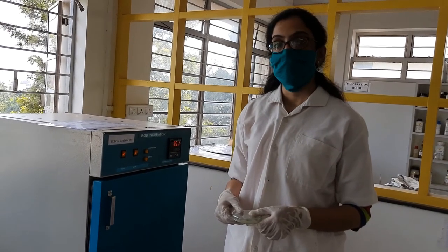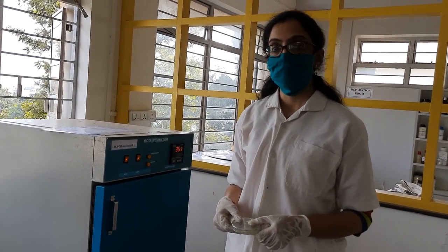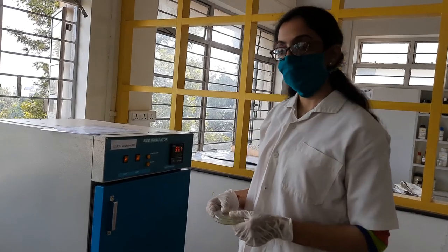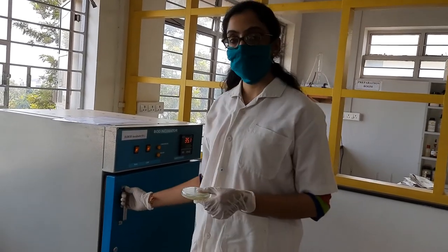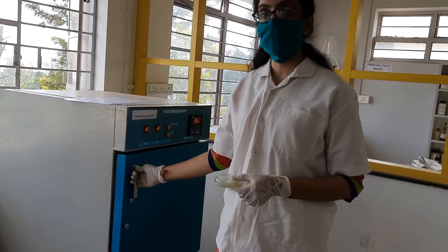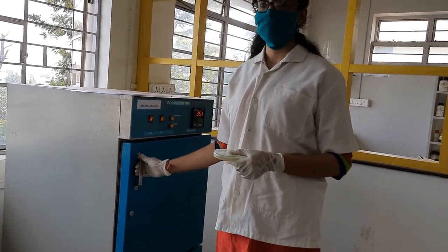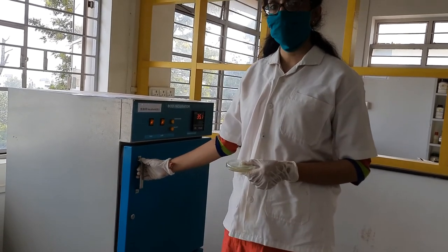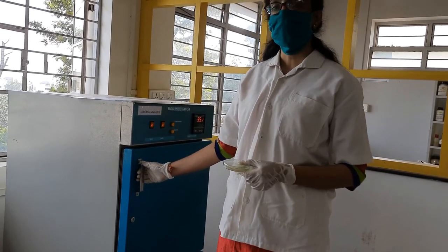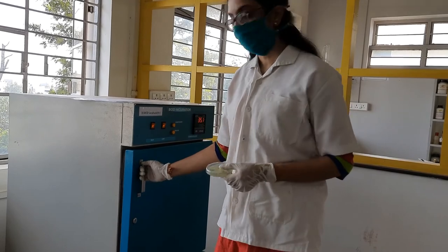After two hours in the refrigerator, place the plates in the incubator for incubation at 35–37°C for 24–48 hours.